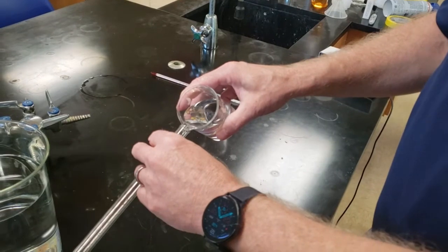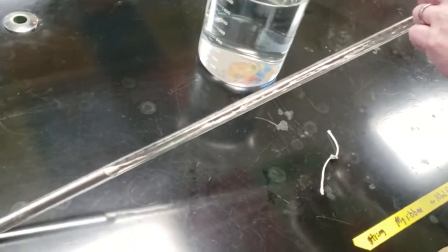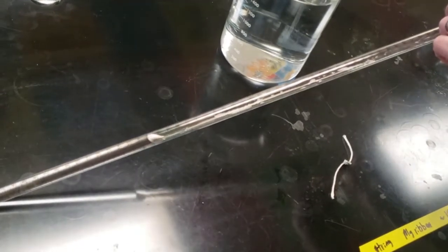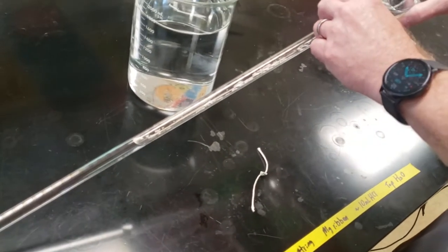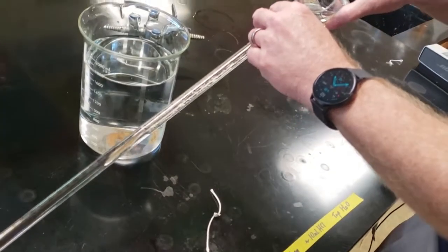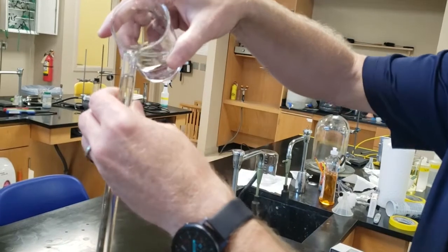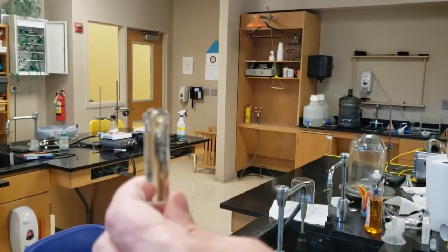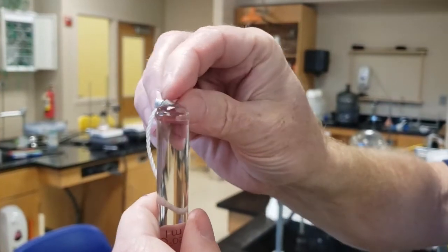Now, with it tilted very low, don't let it pour out, I'm going to pour the tap water in here gently and slowly. I don't really want them to mix. So once I have a good column of water, then I can pour a little faster. The acid's more dense, it'll stay in the bottom. I want to fill it until it's overflowing. This is just water, so if it spills, it's okay.